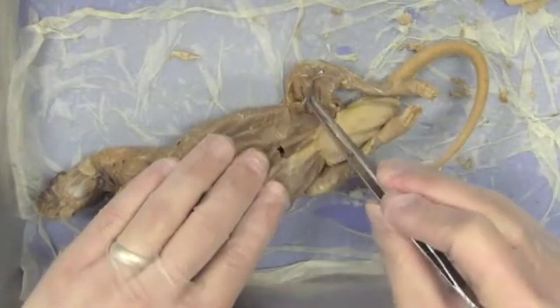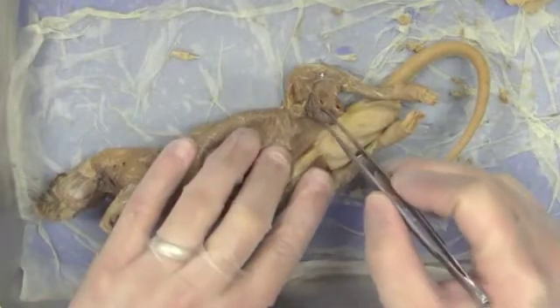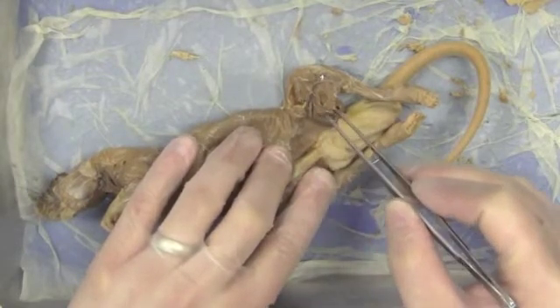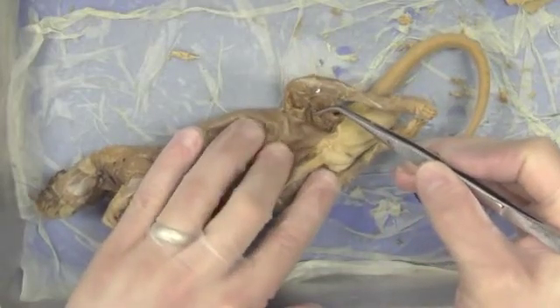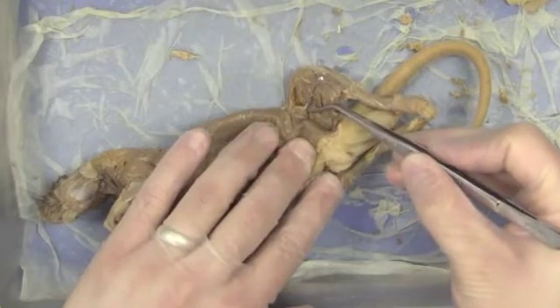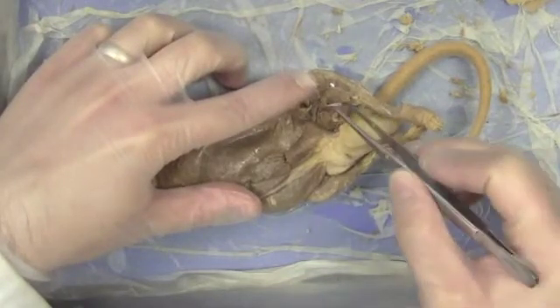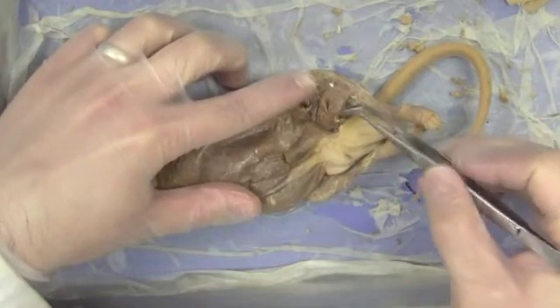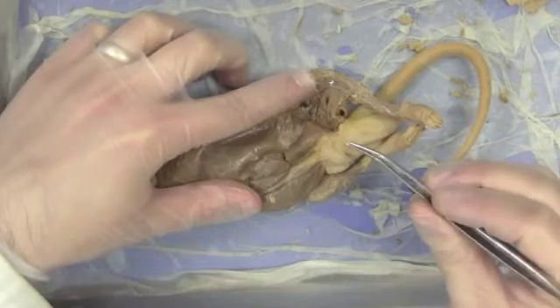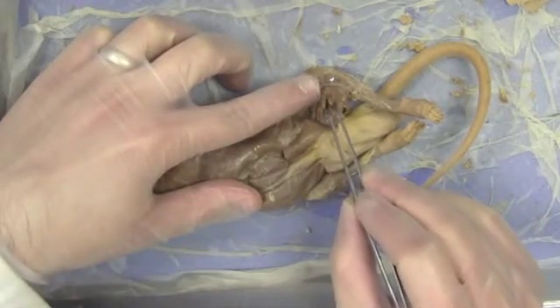Moving down below that large artery and vein, cleaning off some connective tissue — immediately underneath that artery is a small muscle called the pectineus, which is a hip flexor. Underneath the pectineus is a small triangle-shaped muscle called the adductor longus. Underneath the adductor longus, we get into the gracilis, which you'd recognize as one of our groin muscles. If we dig down underneath them a little bit, we'll see another one of our hamstring muscles — that's the semimembranosus.